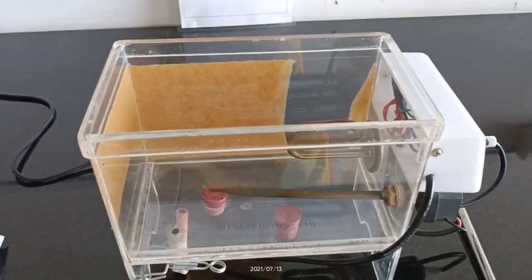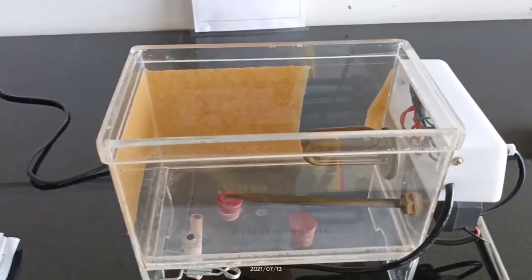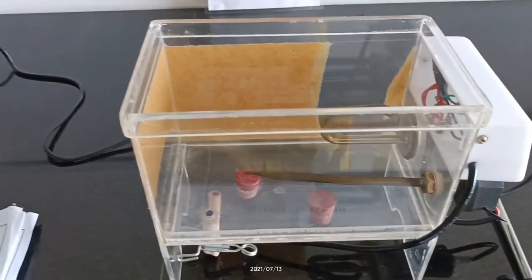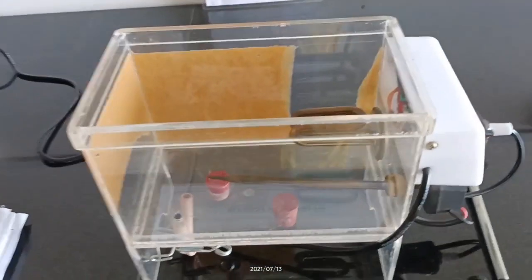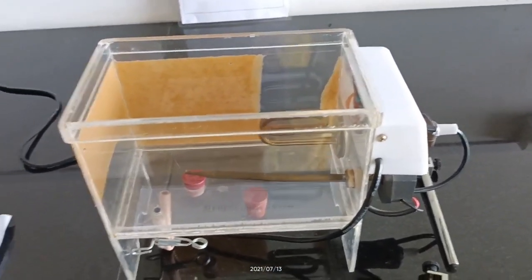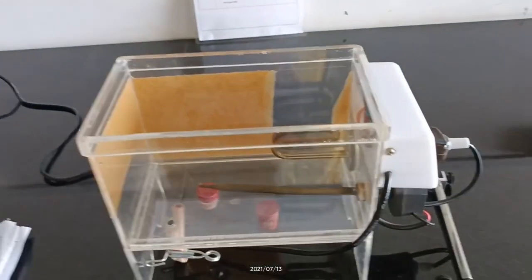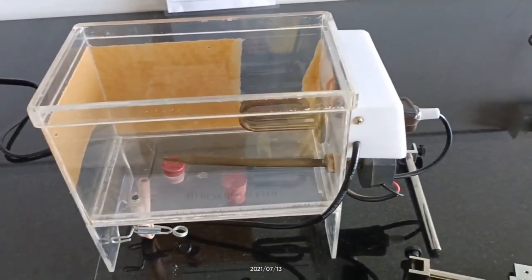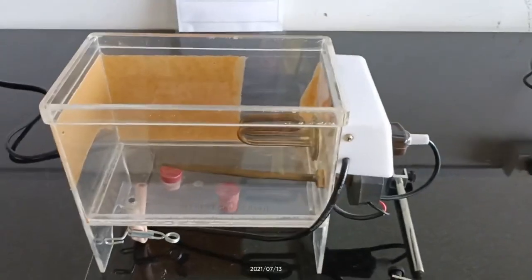The last example is the corpus cavernosum, which is a part of the penis in the male reproductive system. You can take all these smooth muscle tissues for your experimental purpose and then perform your experiments on these tissues for studying the drug effect.